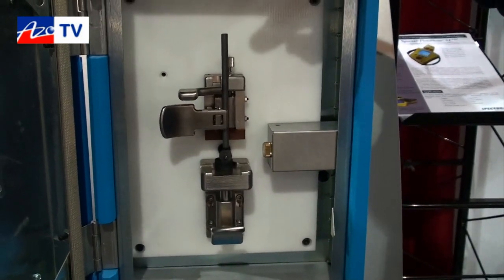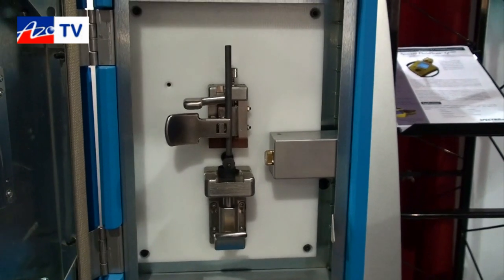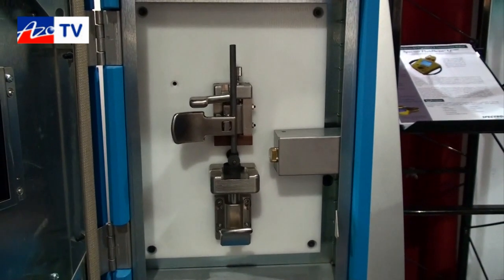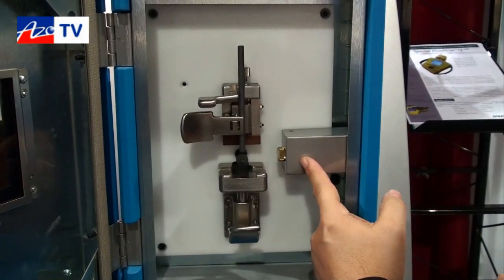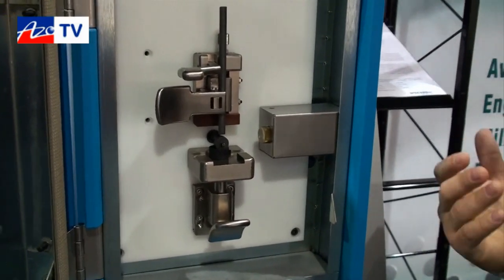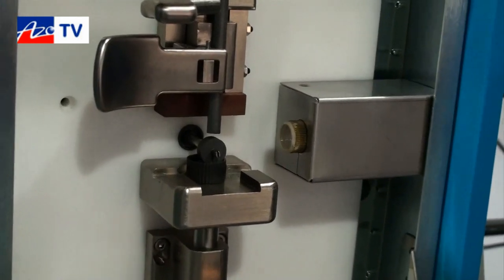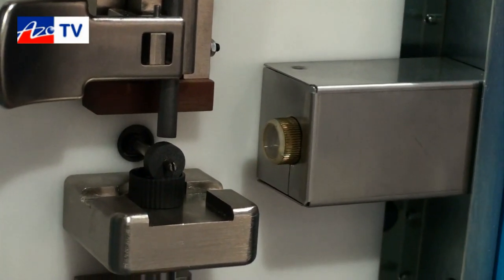The rod electrode will send an arc spark that will generate the excitation of the atoms and the electrons. The light that is emitted when these electrons are changing from one orbital energy level to another will be captured by a fiber optic that goes into the optic. You will then be able to obtain results of up to 32 elements simultaneously in less than one minute.